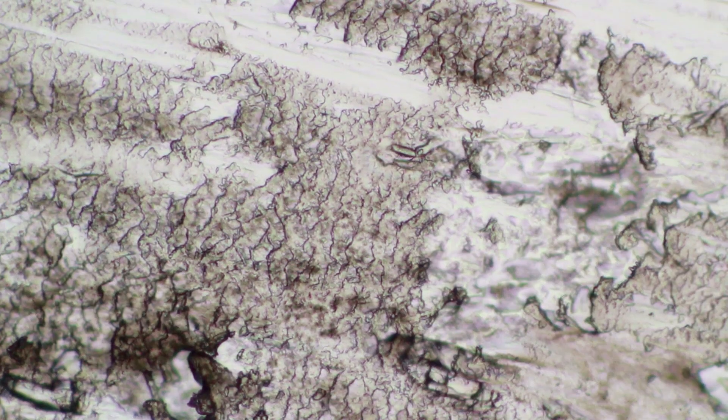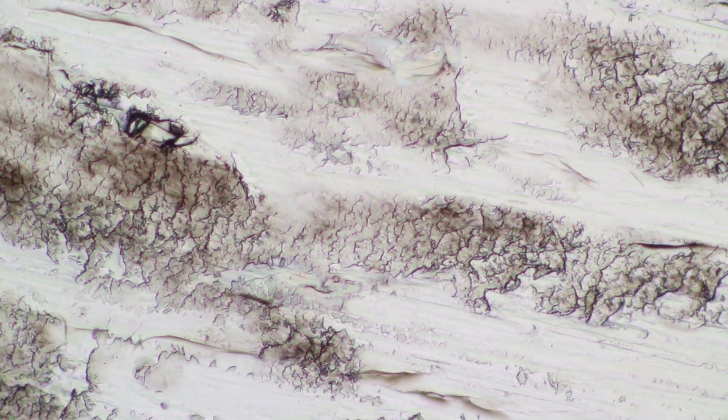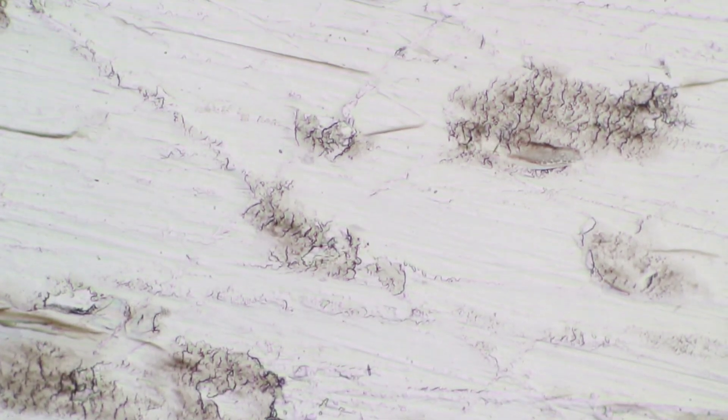Yeah here this is now how it looks like under the microscope again and you can see that there are some nail polish residue left over on the slide. This actually means that the nail polish actually sticks quite well in the rough surface of the slide that I treated with the sandpaper.